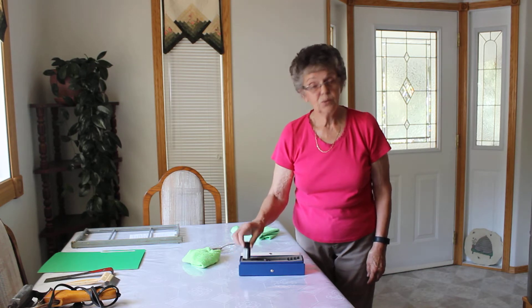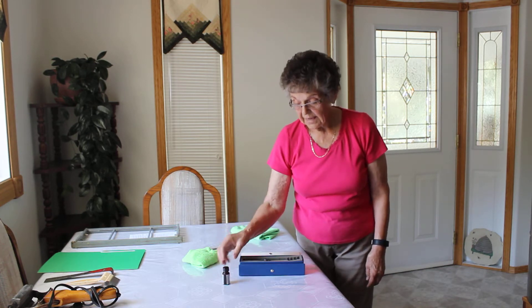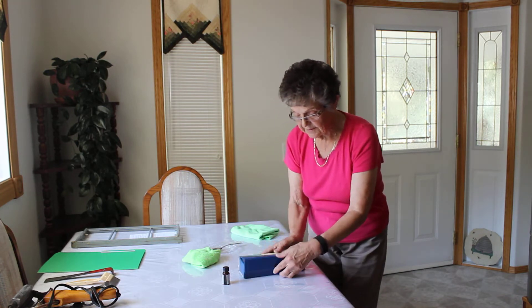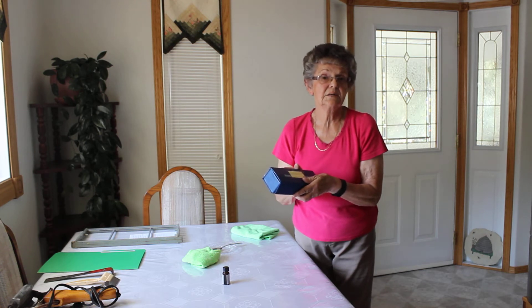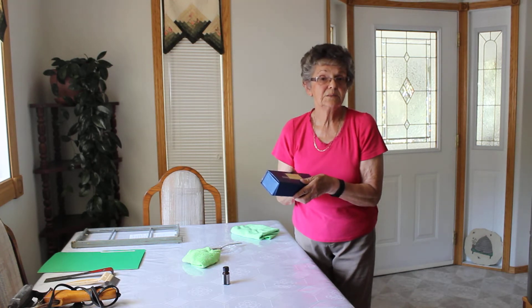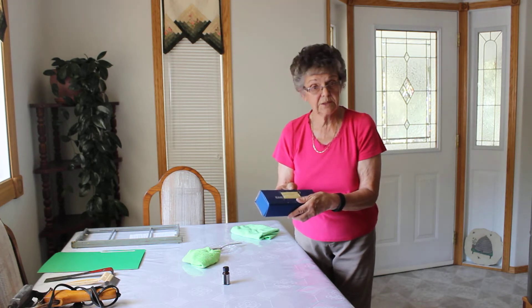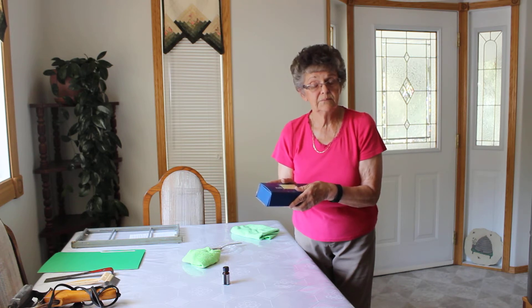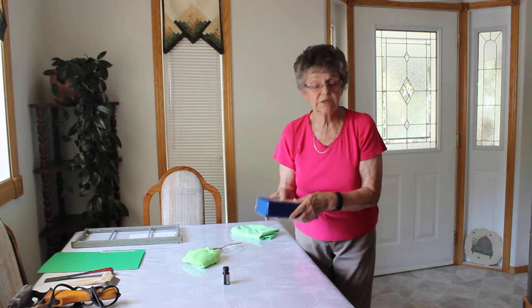So you want to be very careful with that. The refractometer comes in a case. It is a very complex tool and we must make sure it isn't jarred or dropped or anything like that. It is in a good box and can certainly take some jarring, but it is something you want to be very, very careful with.